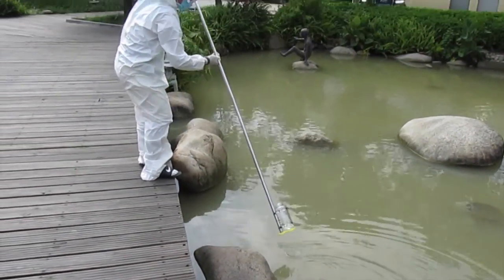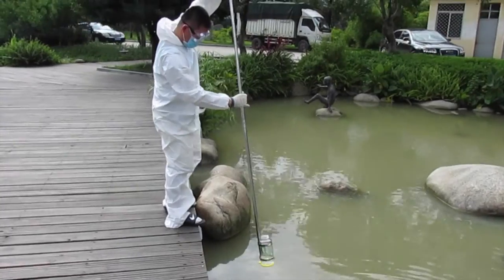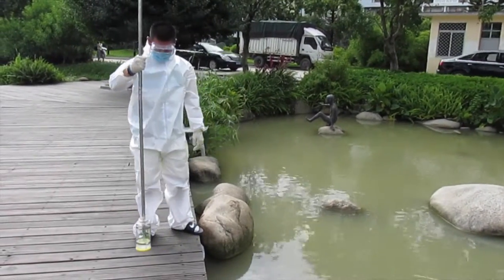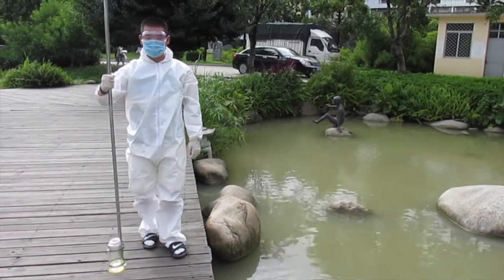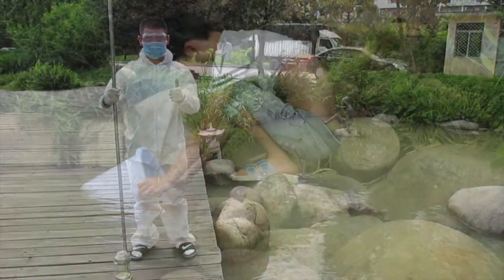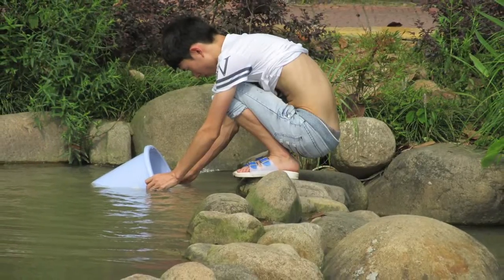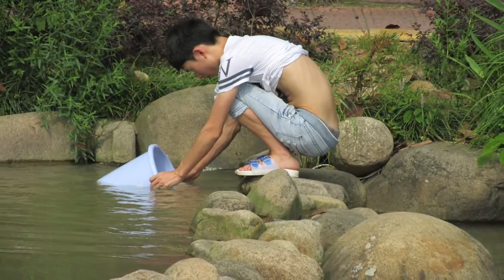Make sure to wear closed-toed shoes unlike the individual sampling here. This is an example of how not to take a water sample.